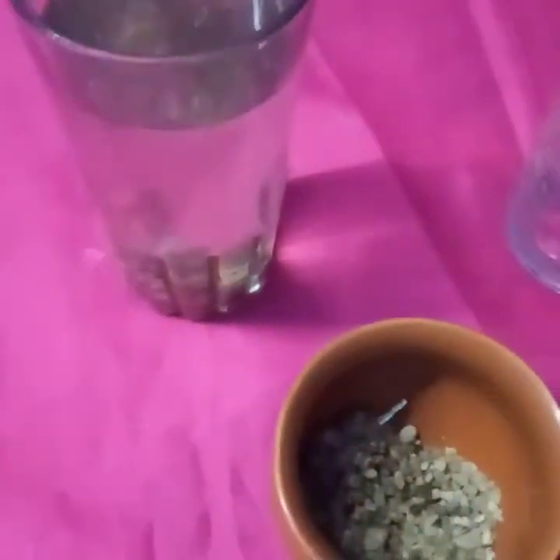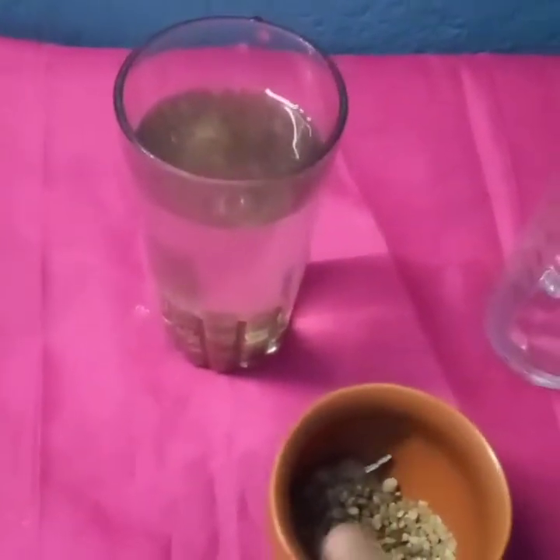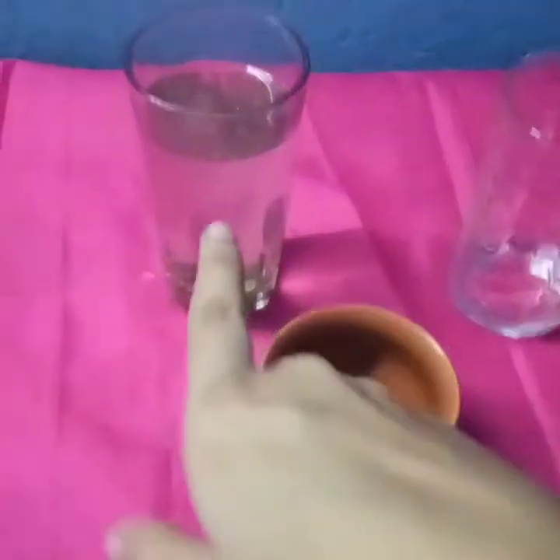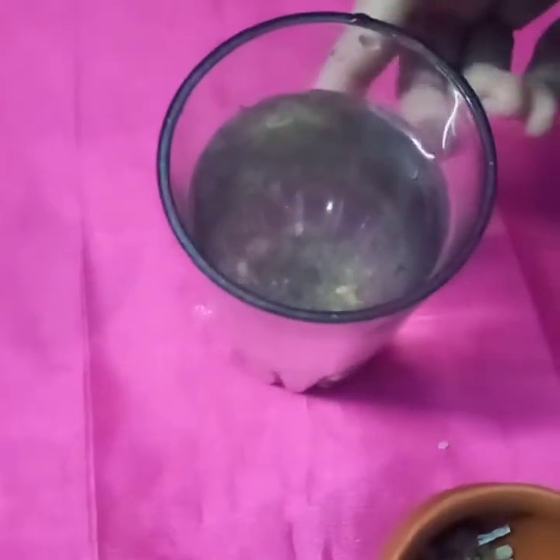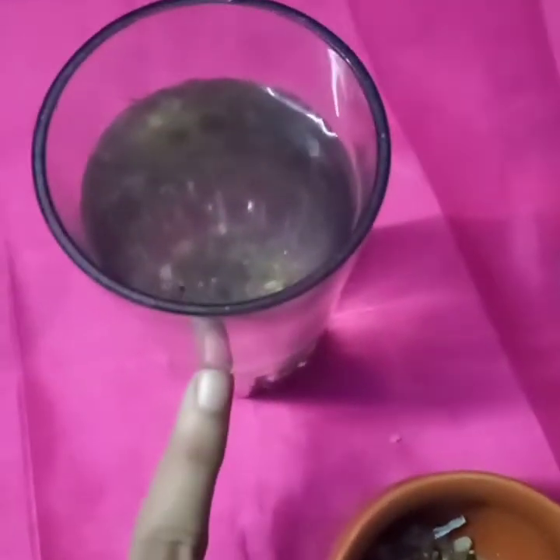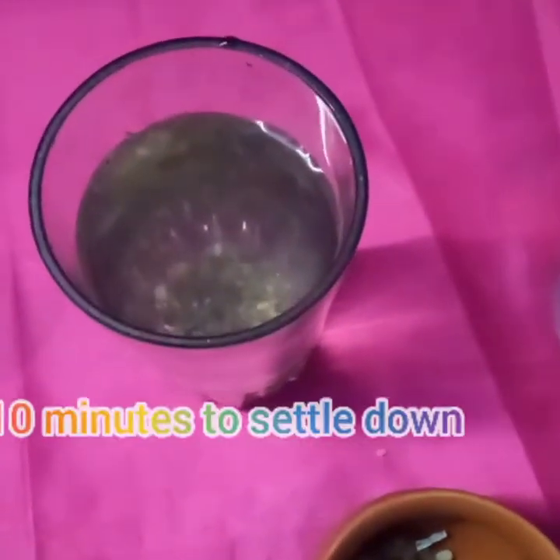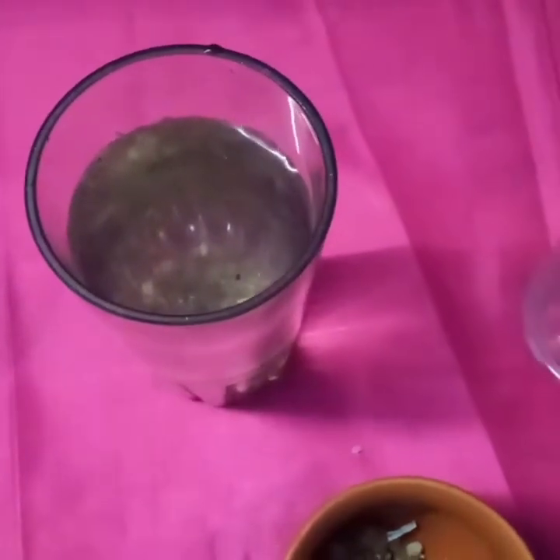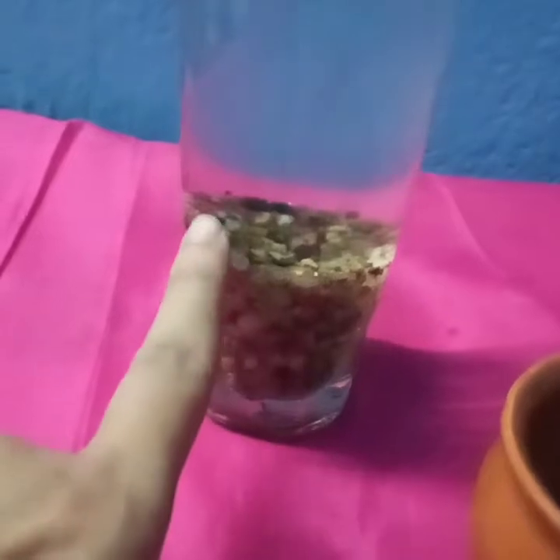Now stir it for a few minutes and then let it stand for 10 minutes. The sand was mixed and came up, now this sand will go down. It will be settling down, and for 10 minutes you have to wait. After 10 minutes you can see how the sand has settled down at the bottom.